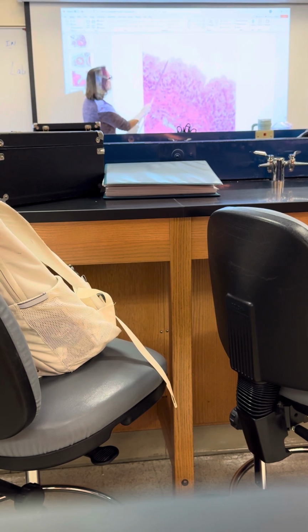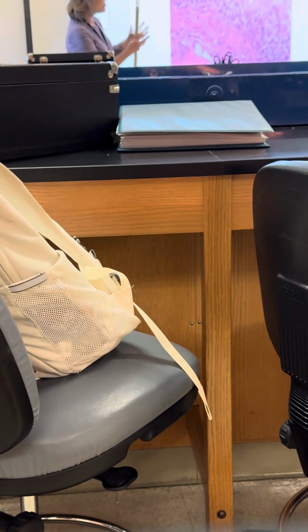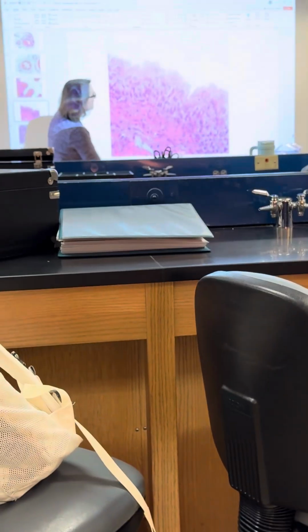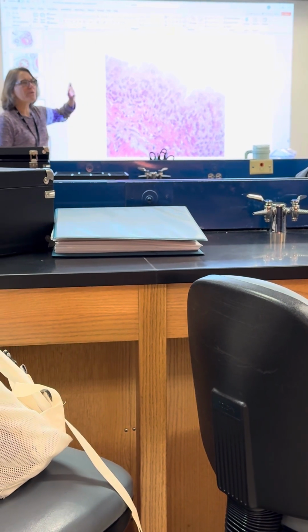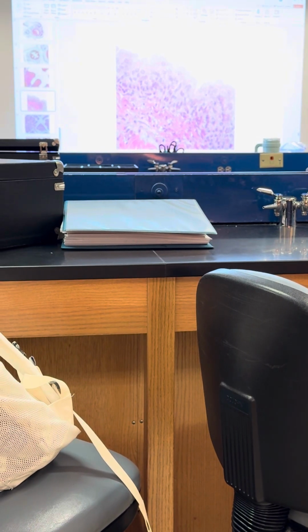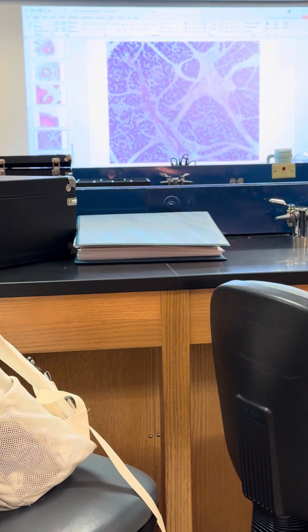So one of the things that helps you recognize transitional epithelium are these rounded cells at the top. Again, when the urinary bladder stretches out, those cells can stretch out more. And that looks a little bit more, but you can see it is stratified. The lab manual has one that kind of looks like that. So that's the urinary bladder. The other one is the ureter, but same idea. Everybody okay with that? Okay. Let's do, does that look familiar?